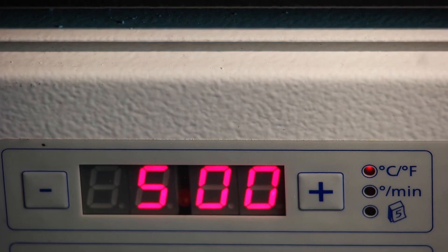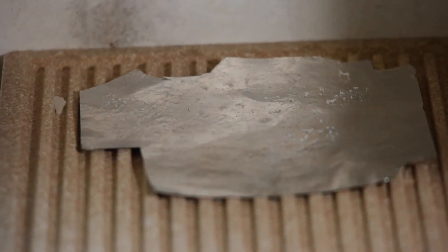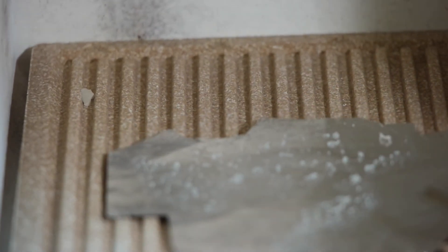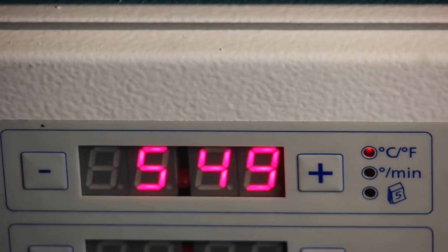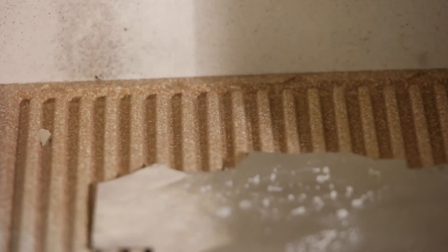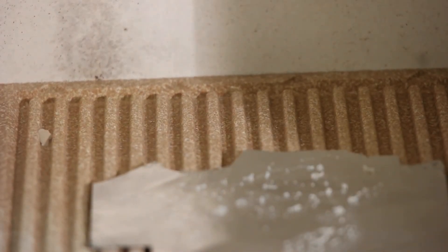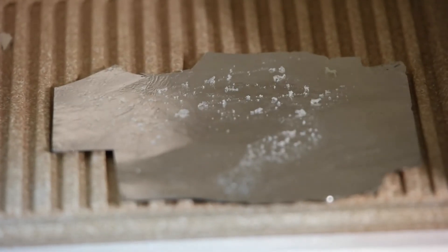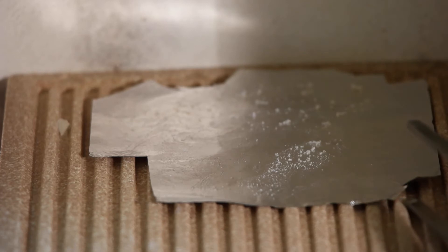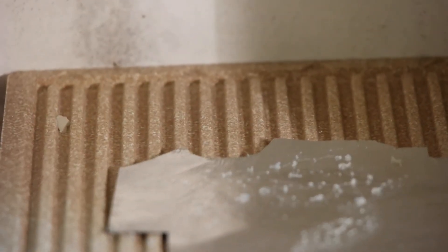That was a quick one! This was a very quick cleanup in the back. As you can see there are still some particles left, and I guess the black remaining is only because it's really at the front. I'll push the platinum foil a little bit back so we have a more even distribution of heat. The black has disappeared totally — there's still a little bit of white crust left but not that much. I guess it's similar to the blue one, where the crust stays there for a while until we reach a higher temperature around 900 degrees.